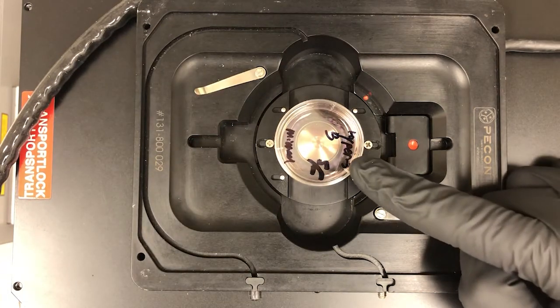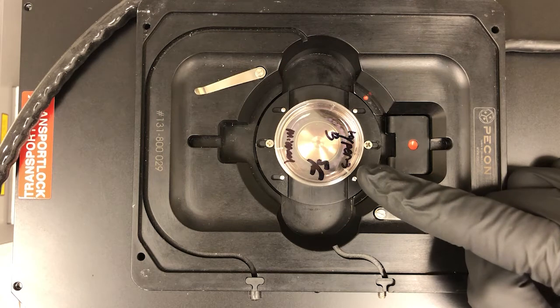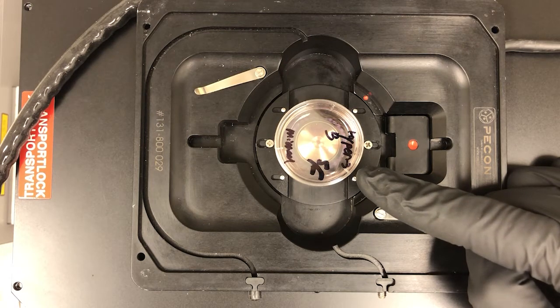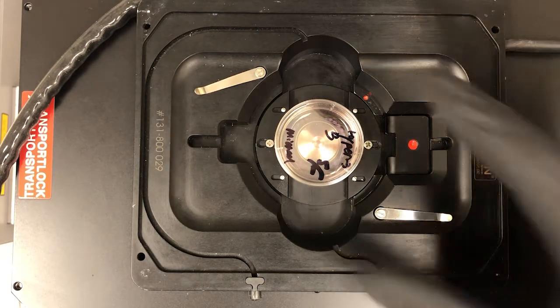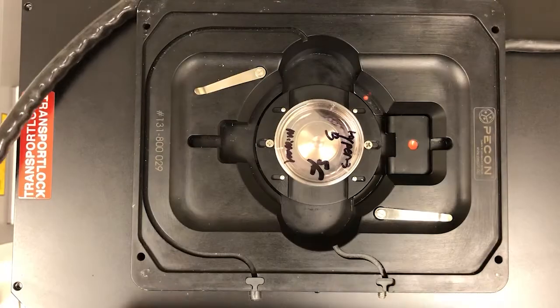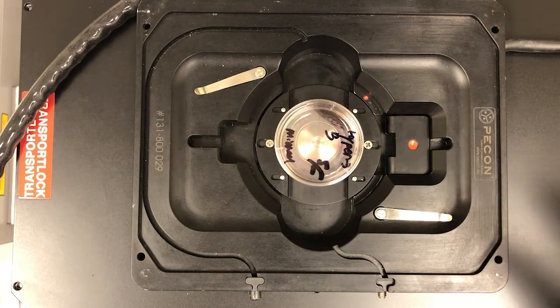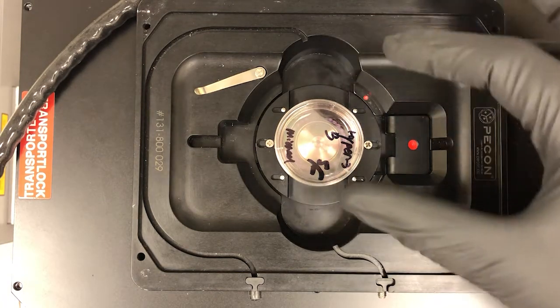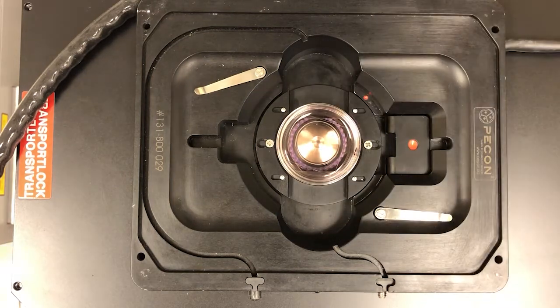The question of whether to leave the lid on or off depends on whether you want to do DIC imaging. If you do, you should remove it, as that kind of imaging, which is a form of bright field contrast enhancement, does not work well through plastic, but does work okay through this. So since I actually want to keep the option of doing that for the particular experiment I'm doing now, I am going to remove this, but if you're just doing fluorescence, you can leave the lid on. So I'm gonna remove that.